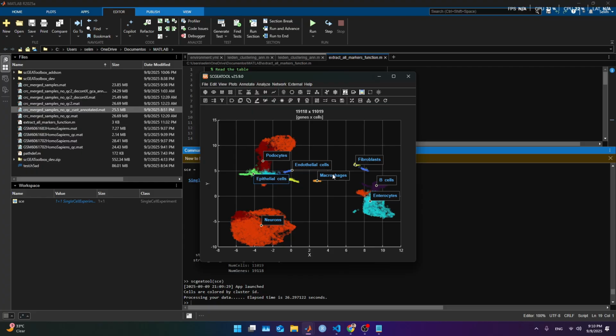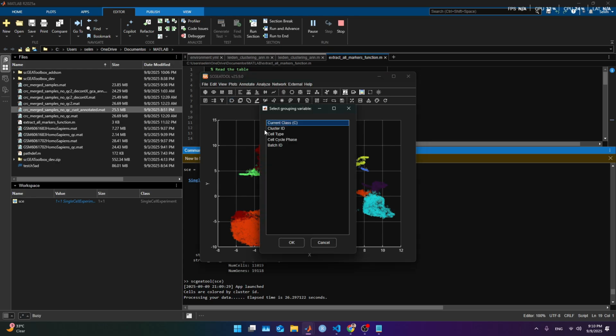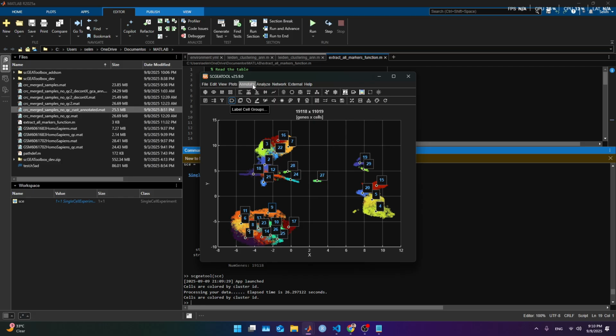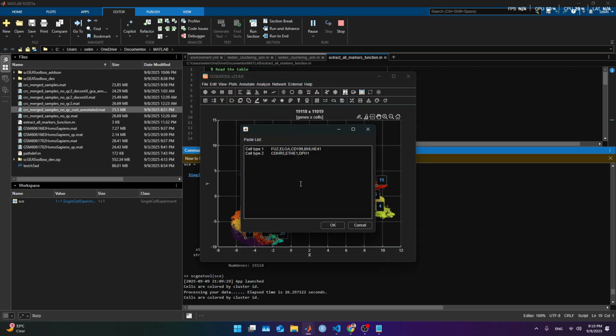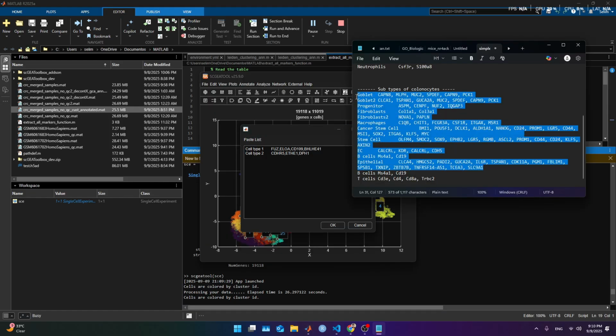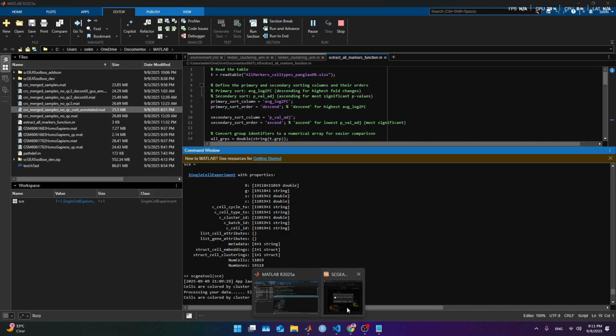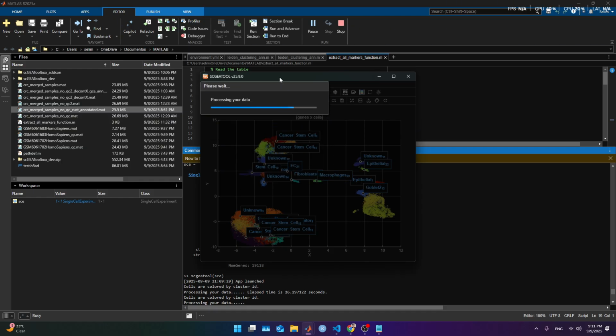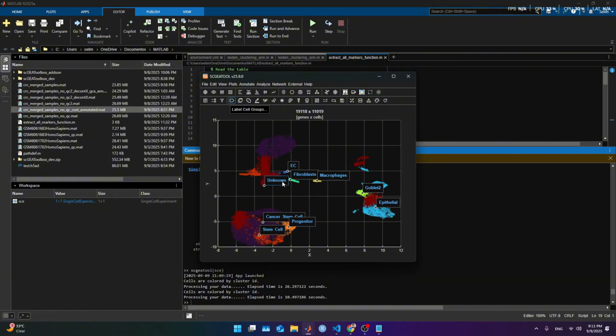And this is what we get. It looks fine. B cells, fibroblast, endothelial, epithelial here. And for last, we are gonna try our previous marker set. You're gonna hit on cluster ID, and then you're gonna annotate with customized markers. Here, I'm gonna paste the markers we built before, and I'm gonna include the B cell and T cell markers. Gonna stop it and come back when it finishes. Oh, it's about to finish though. Okie dokie. This is what we got.